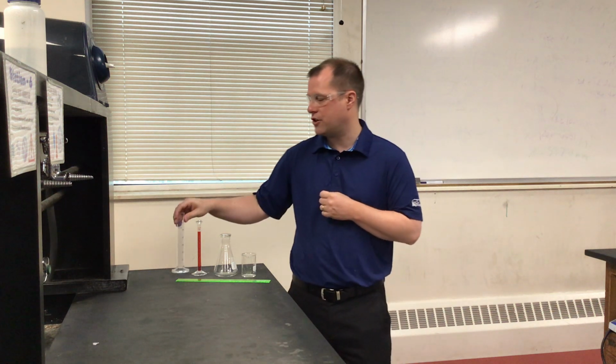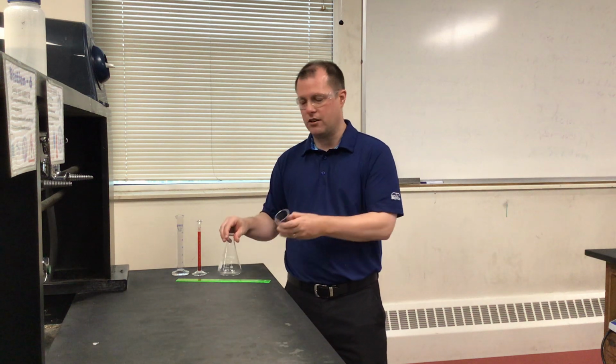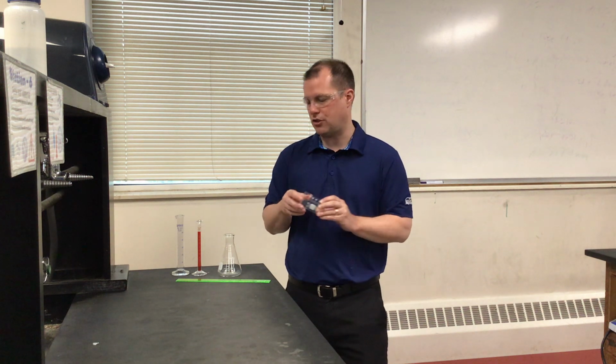That's why they have more in-depth tick marks or calibration markings on them for us to be able to measure volumes, in comparison to, say, maybe an Erlenmeyer flask or a beaker, where our actual calibration lines are a little bit more spread out and aren't going to give us quite as precise measurements in terms of the number of significant digits we can report for them.